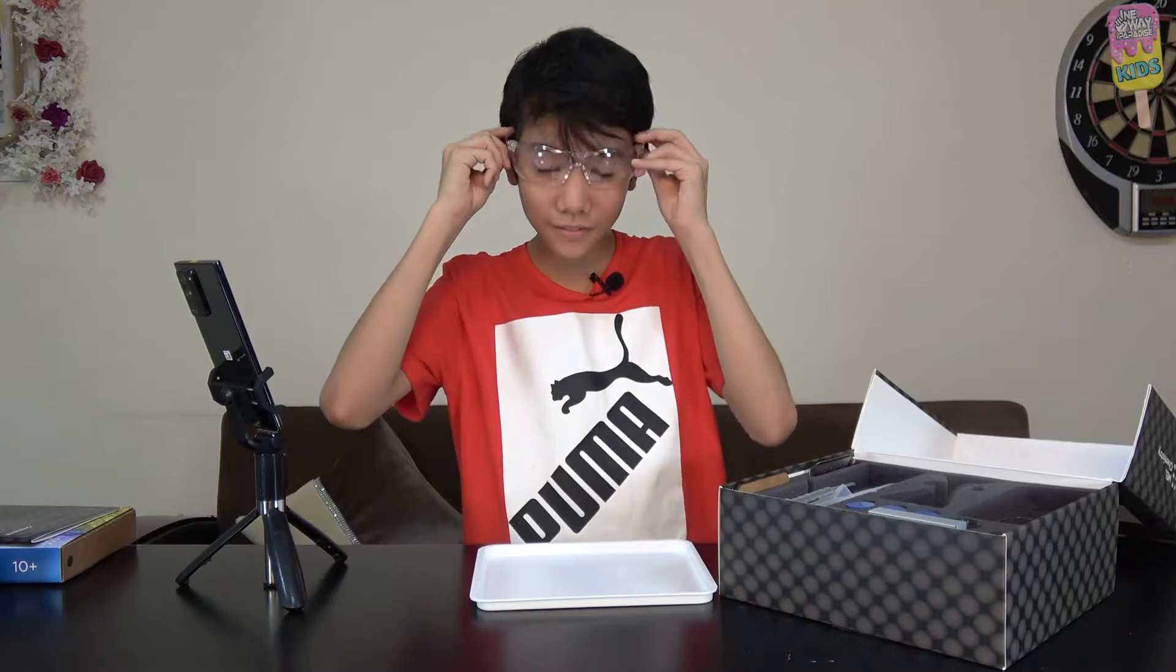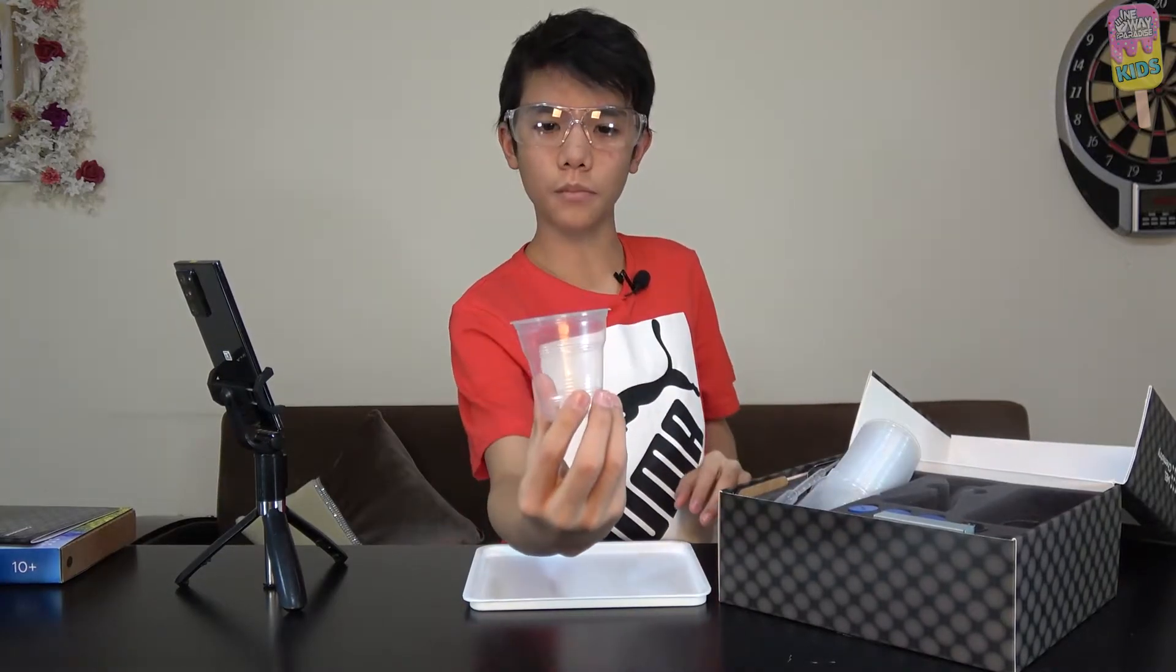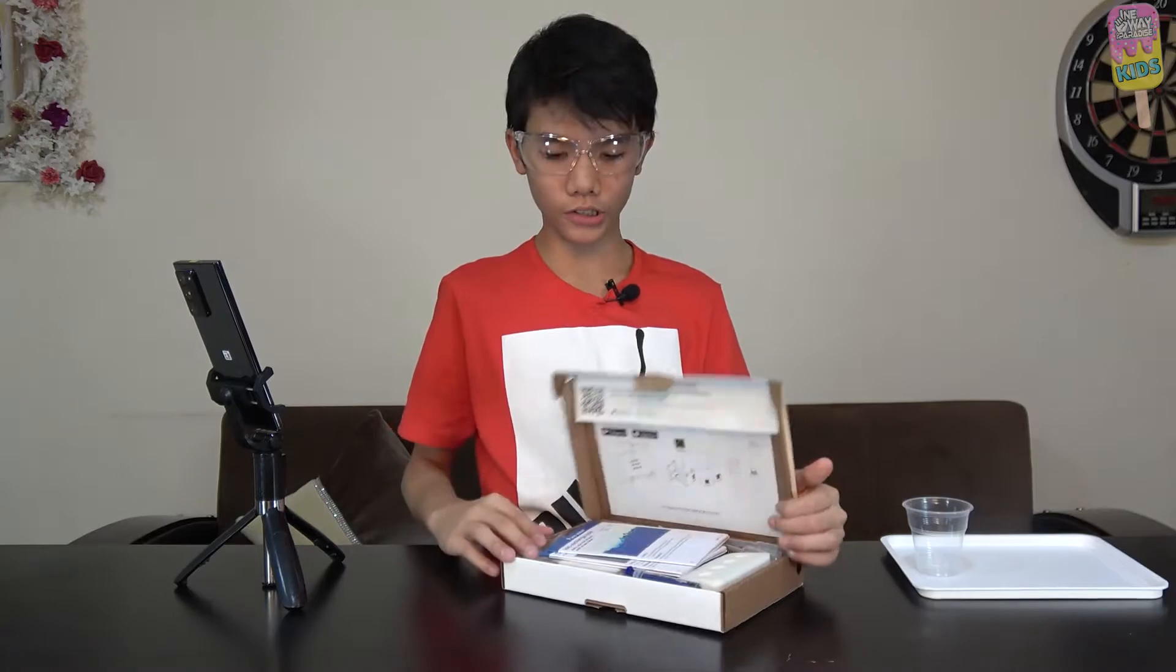From the starter kit, we're going to want to take a tray, some safety glasses, and a disposable cup. With this aside, we're now going to open the pure water set.